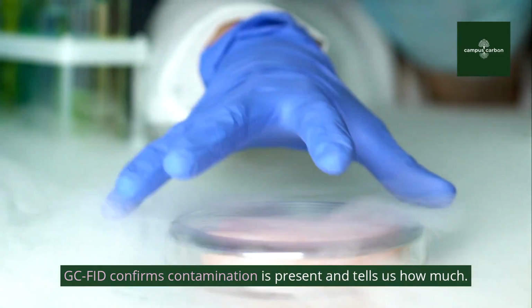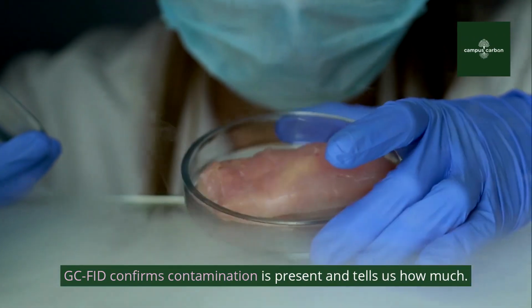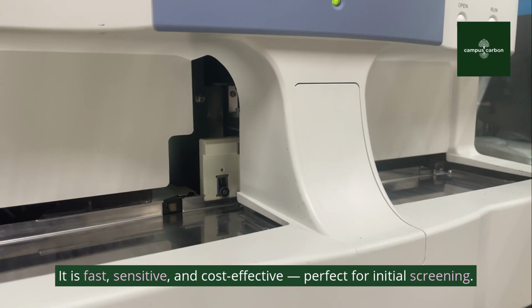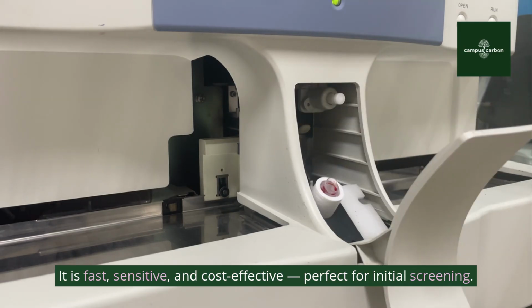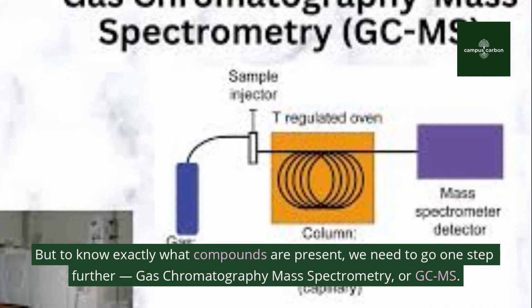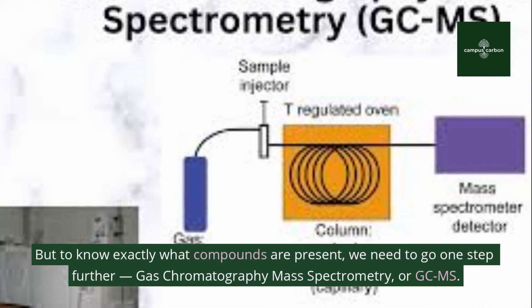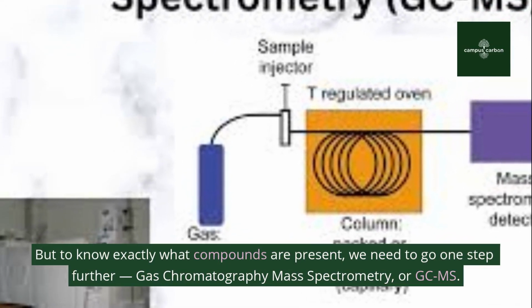GC-FID confirms contamination is present and tells us how much. It is fast, sensitive, and cost-effective, perfect for initial screening. But to know exactly what compounds are present, we need to go one step further: gas chromatography mass spectrometry, or GC-MS.